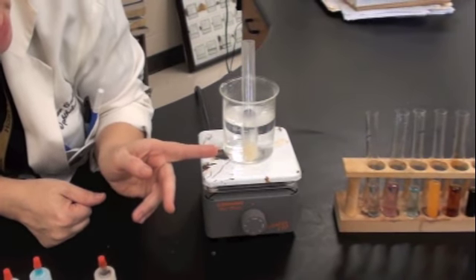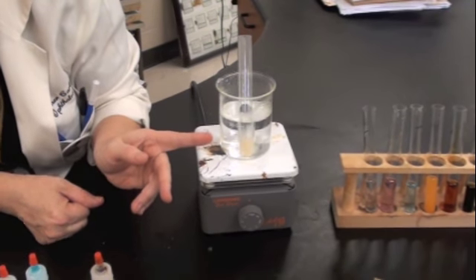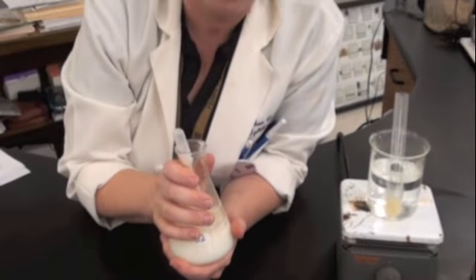I think we're beginning to see a color change. We're definitely not light blue or Easter egg blue anymore. As we set up the unknowns, different types of unknowns and different amounts, let's say I used powdered milk, or I used powdered gelatin, or I use corn syrup, the amount that I put in will make a difference in how quickly the reaction happens and what it looks like.